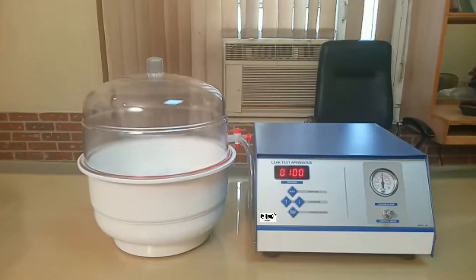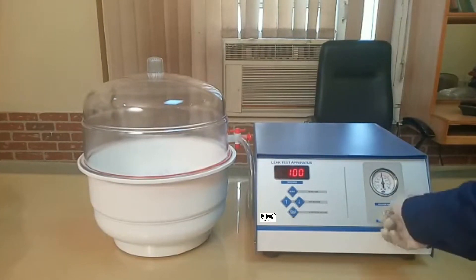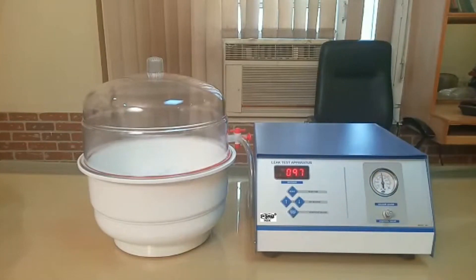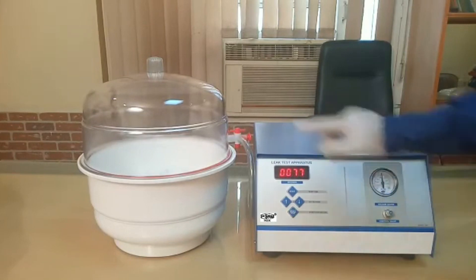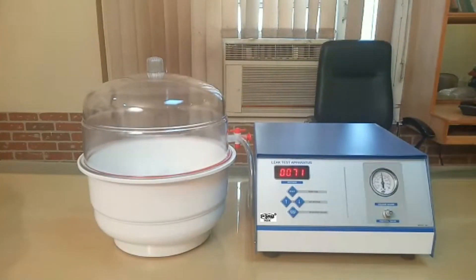If you want to stop at four hundred mm Hg, simply close this valve at the desired vacuum range. Close the valve completely and then press the stop key. The timer will start counting backwards. The machine now holds a pressure of 400 mm of Hg in the desiccator, and the countdown timer starts from 100 — 99, 98, 97 — downwards.